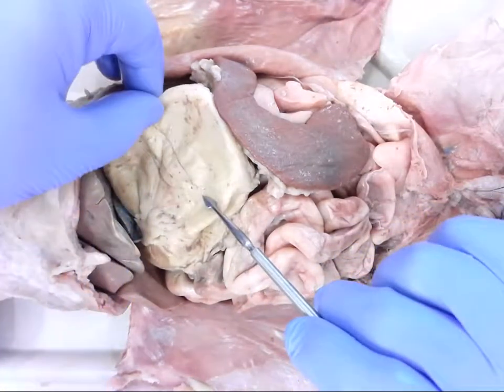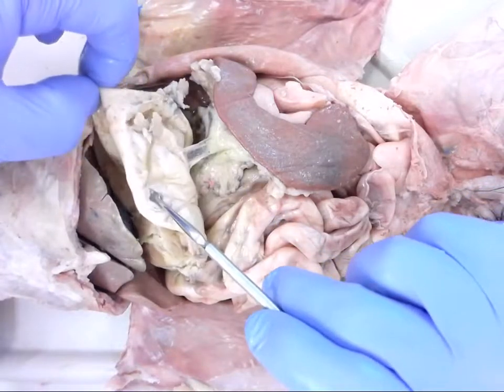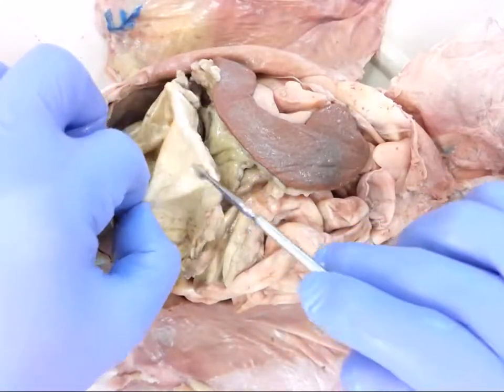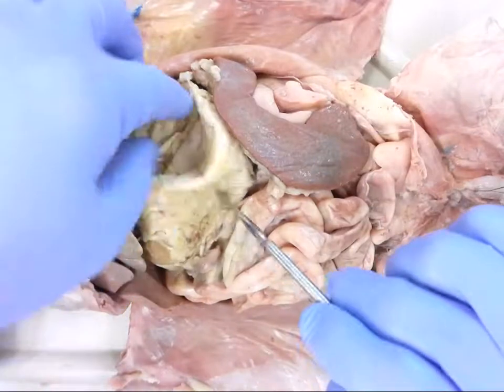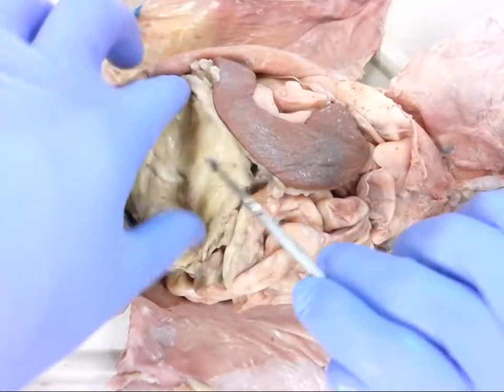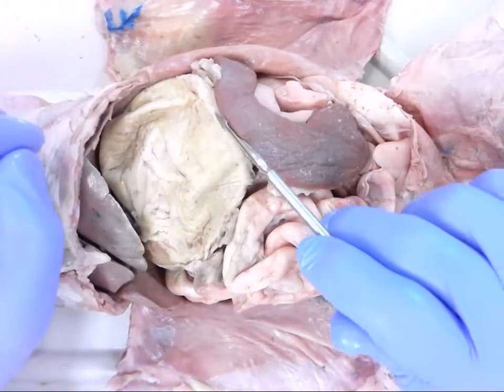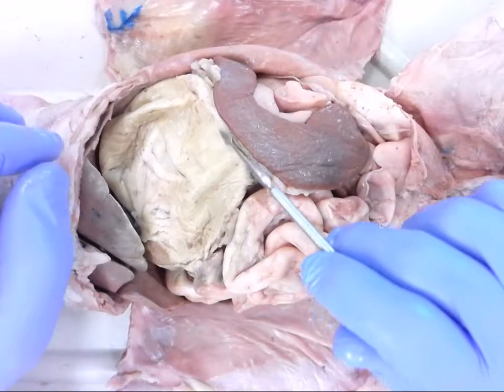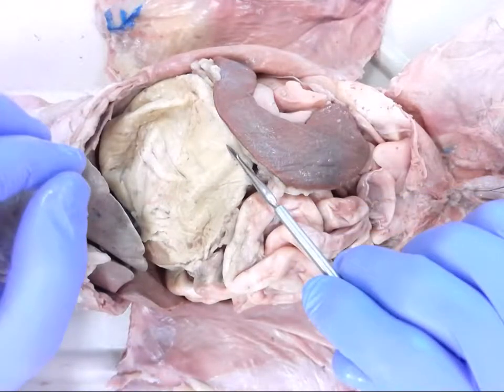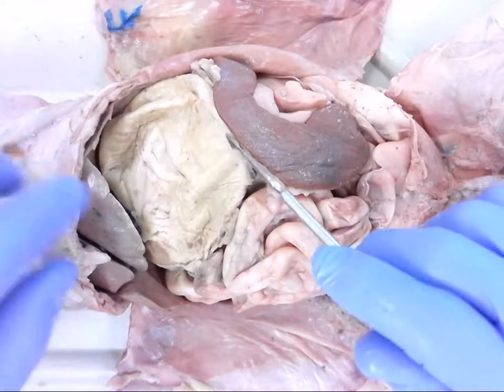As you work through your lab you're going to actually cut into the stomach — I'm not going to do that today. This one actually feels quite empty, but what you'll see when you get inside is probably some partially undigested food and some folds also known as rugae, which help to increase the surface area of the stomach.